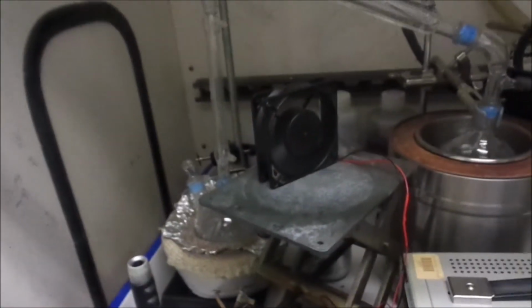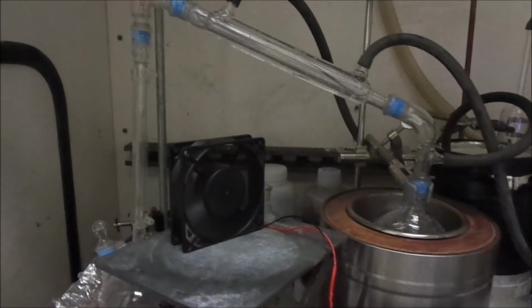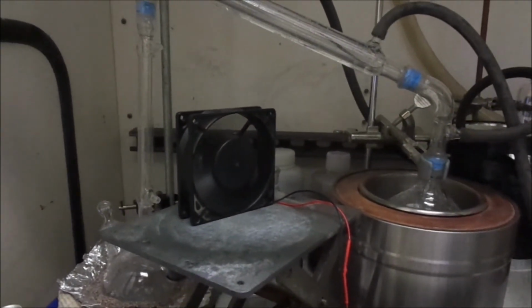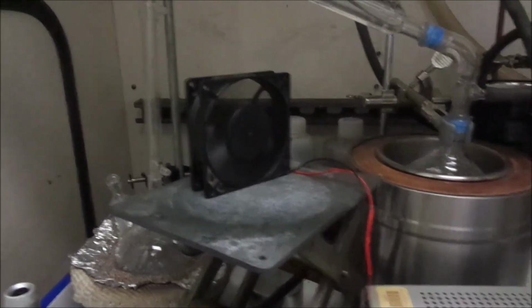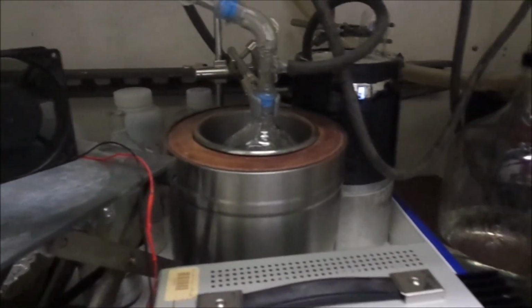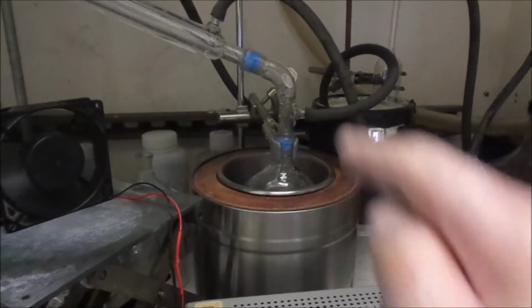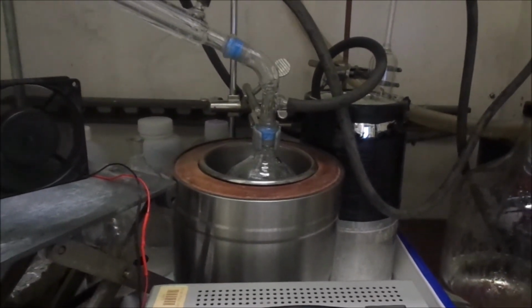I'm about running out of time. I got to get my son off to school, but I'll end up shutting this thing down so I can go take care of family stuff, then I'll come back, turn it back on, and get the thing wrapped up. But we knew it was going to take a while. When you add on a distillation tower, things go slower, but you end up with a much purer fraction on the other side. I think it's worth the time, and I think that this is going to work really good for us for the next phase of the project.